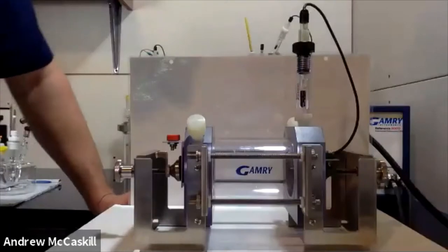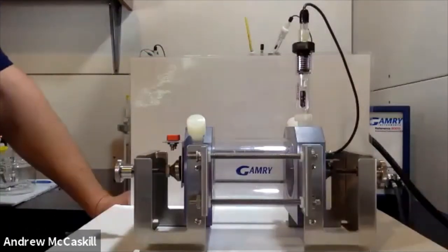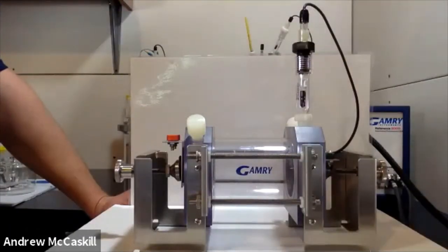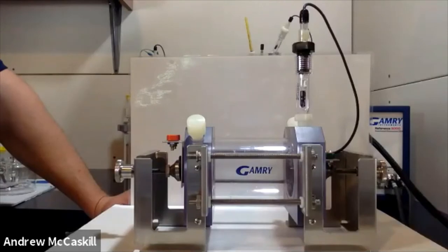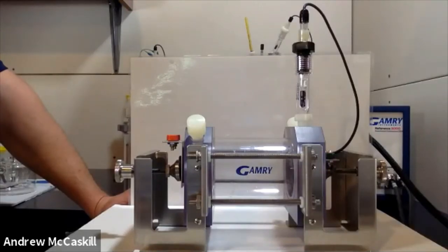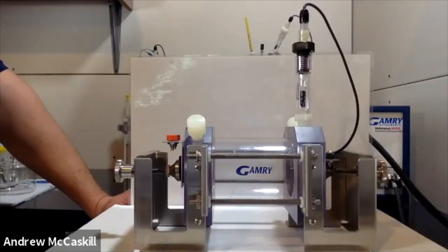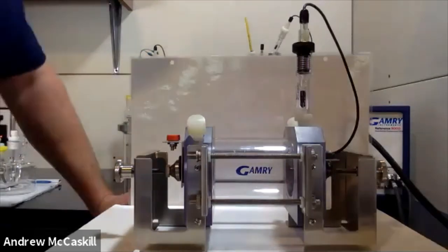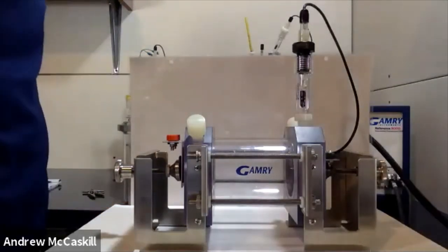The sample masks are available in three pre-cut sizes: 1 cm², 3 cm², and 10 cm².